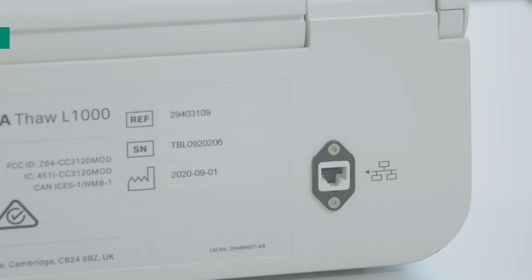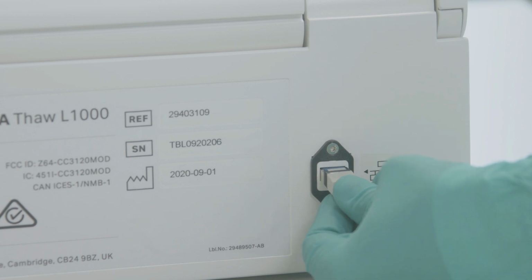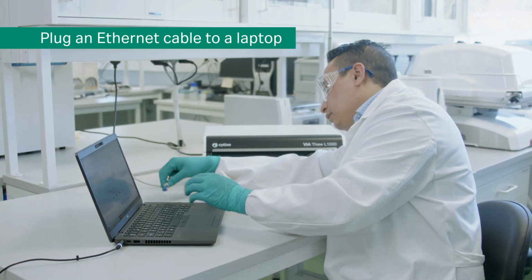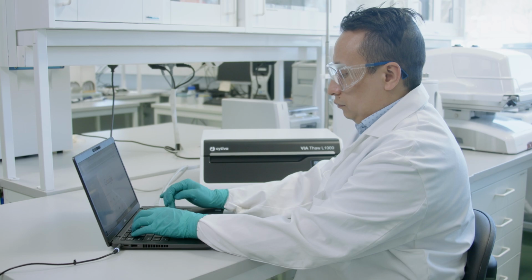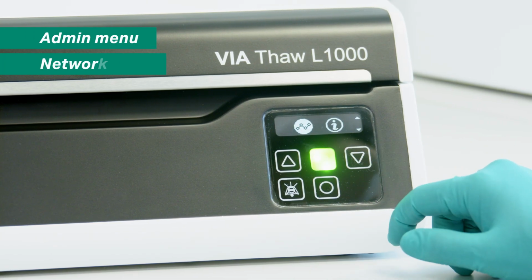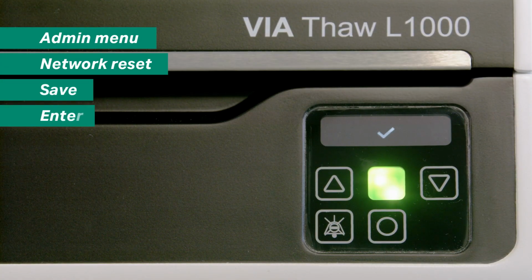Step 2. Wired Setup. To use a wired network connection, plug an Ethernet cable between the network port on the rear of the instrument and a laptop. To connect the instrument to your network, first reset any existing network settings by navigating to the Admin menu and then selecting Network Reset on the instrument's control panel. Select the Save icon and press the Enter button.